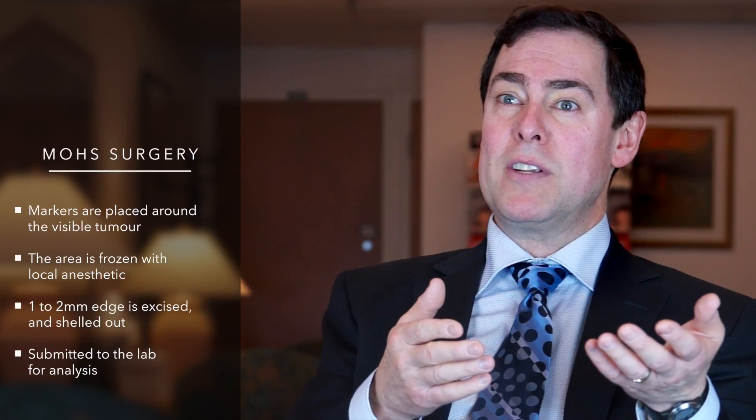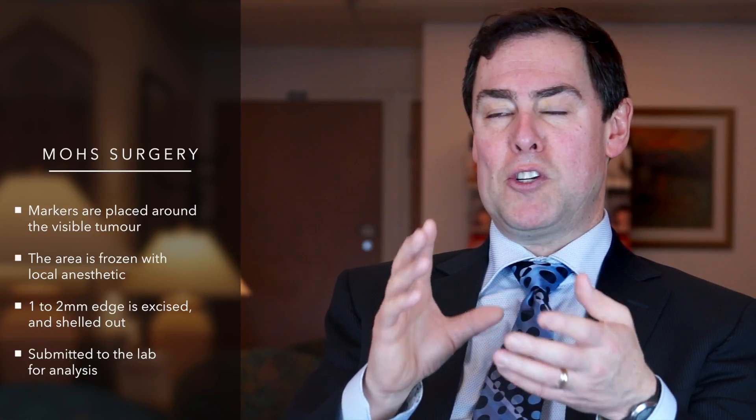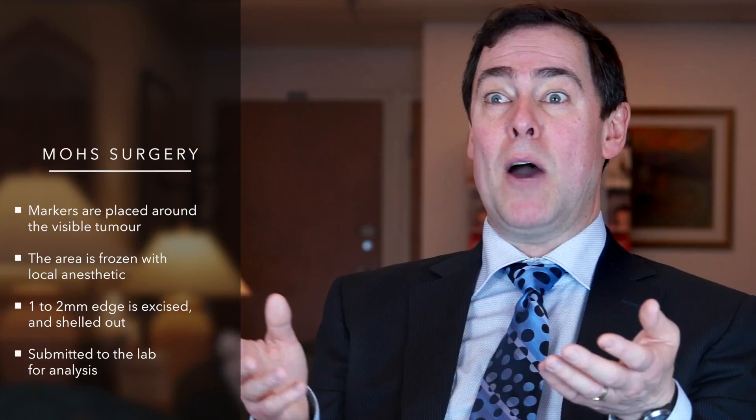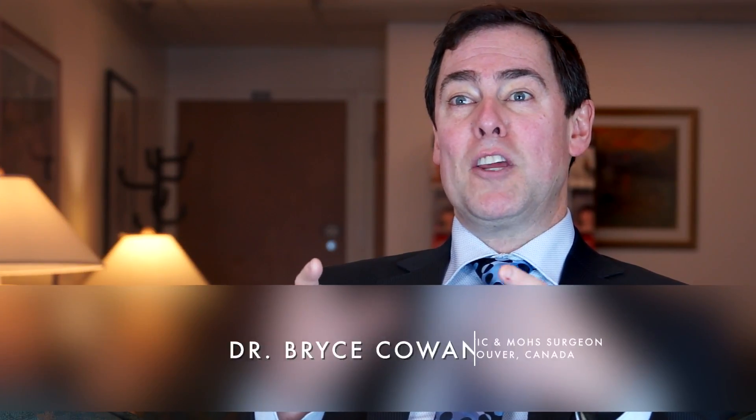That area is then shelled out and taken to a separate table and counter where the tissue is divided, dyed, and submitted into the lab, which is part of the facility. The surgeon then communicates with the histotechnologist, describing the areas that are critical for visualization. The histotechnologist uses specialized techniques to allow relaxation of the tissue and complete visualization of the entire tissue margin.